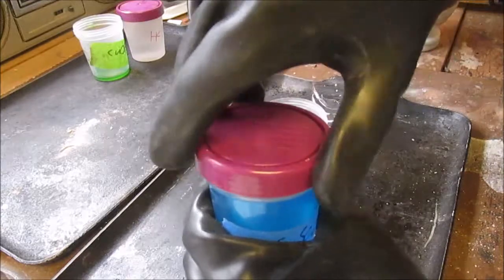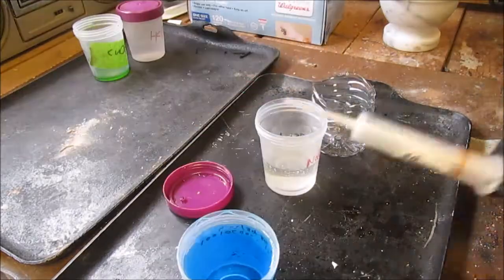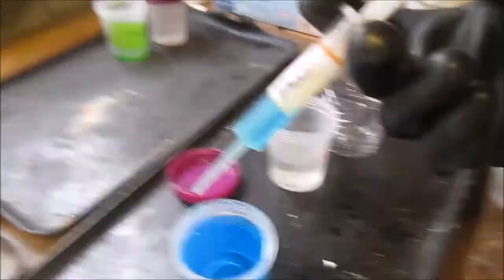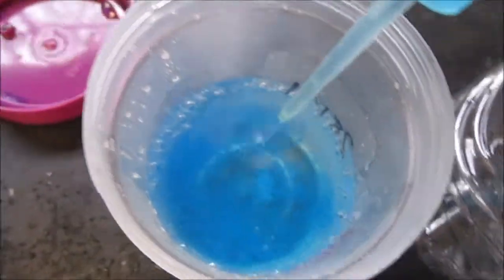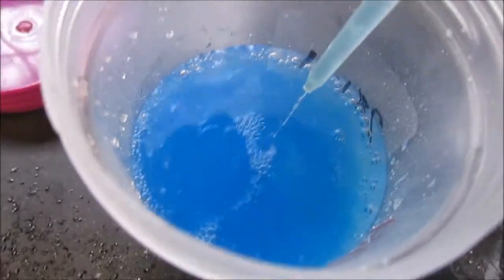Whatever that, so take your copper sulfate, open that right up. Now this one I have a bit too much copper sulfate in here. Take your copper sulfate, add it in there, see? It's precipitating out very nicely. Very, very insoluble solution of copper hydroxide, there it is.